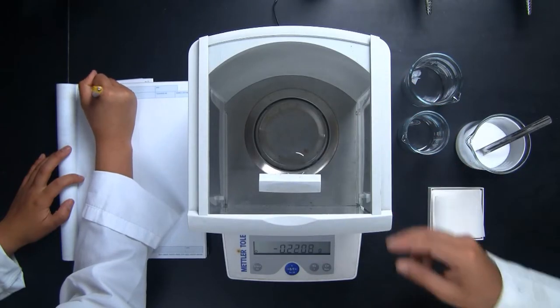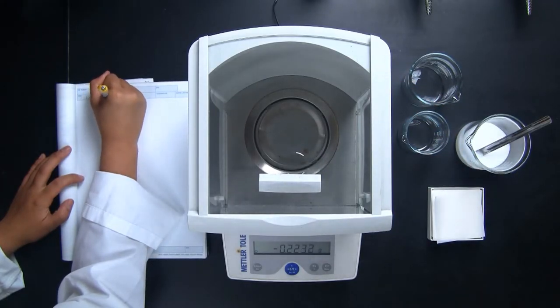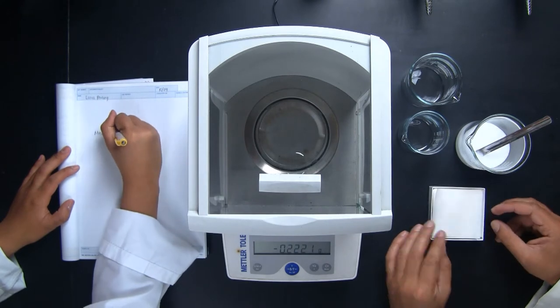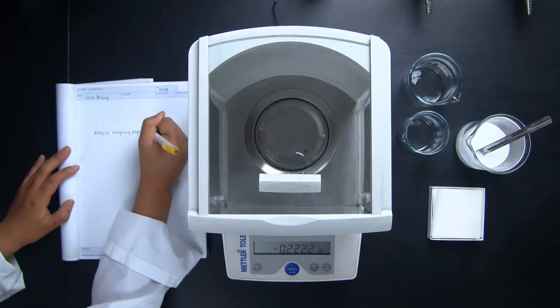Careful mass measurements are the foundation of good laboratory work. Wendy has a new partner, Ash. They need to weigh some things. This time, instead of weighing into a beaker, we're going to weigh onto a piece of weighing paper.